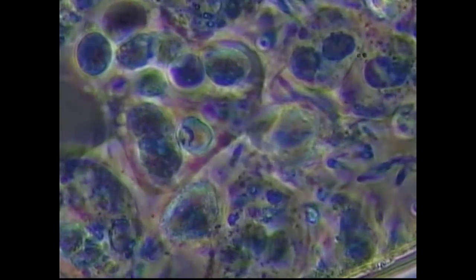Still moving around inside the vacuole. I'm going to highlight it again with a red arrow in case you lost track of where he's at. In this view, it looks like there might even be two spirochetes in that food vacuole. Anyway, this is one of my favorite slides.